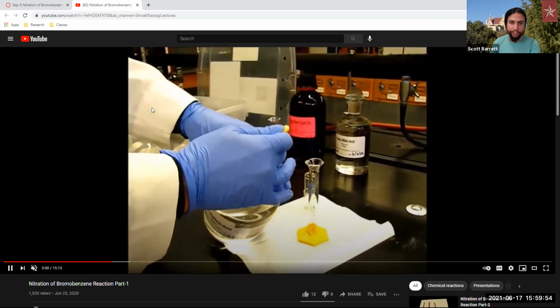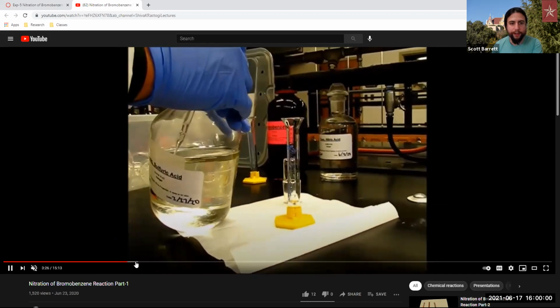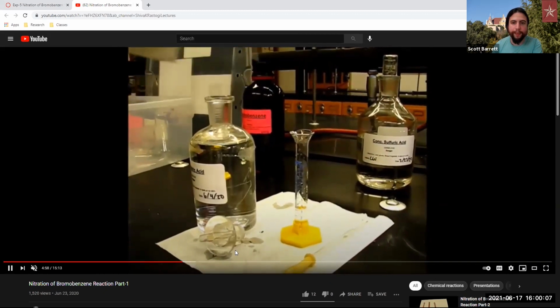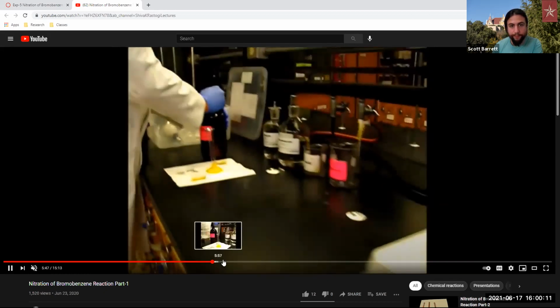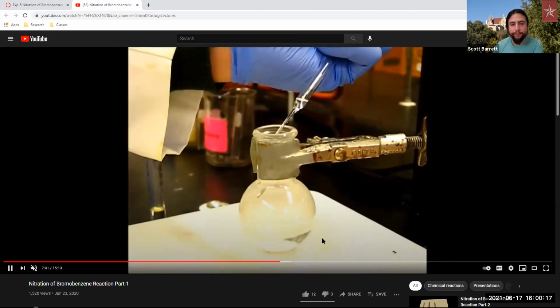So then, now that we've gone forward and we've already discussed the mechanism, you can review it again watching this video or on the video here that I'm going to post. We take our sulfuric acid. I'm going to kind of skip through because it's very, very simple, and you can watch that part. They take a lot of time and safety because it's acid. You want to be careful. You take your nitric acid, put them together, okay? Then you have your bromobenzene. You add it in there, dropwise.